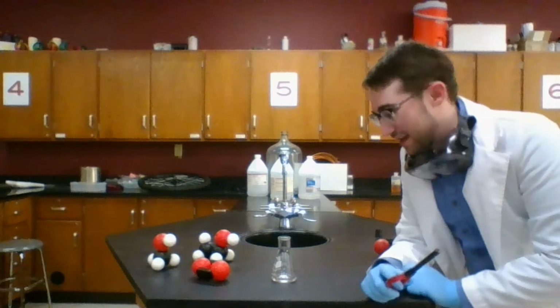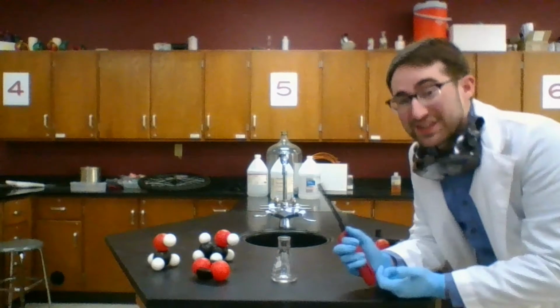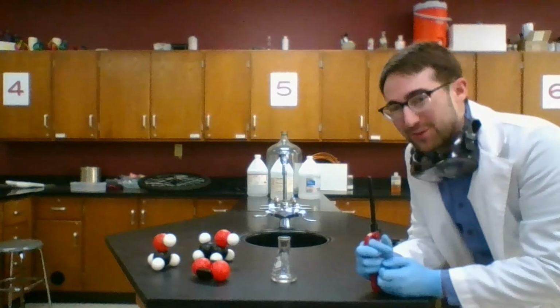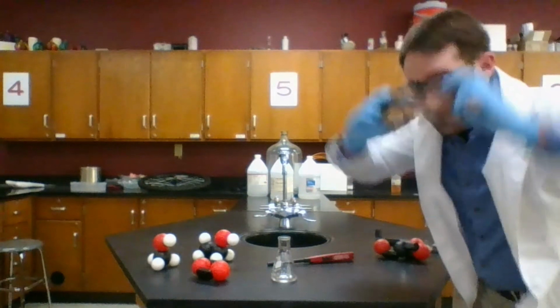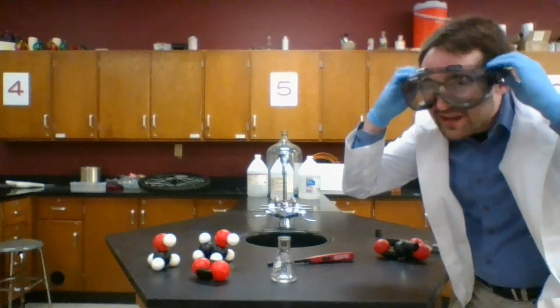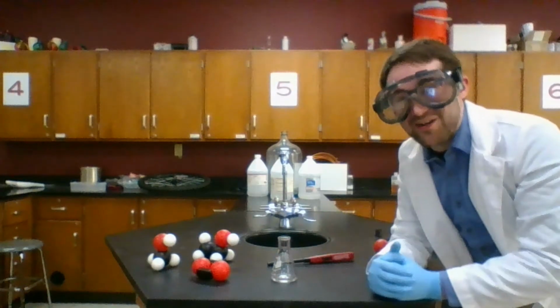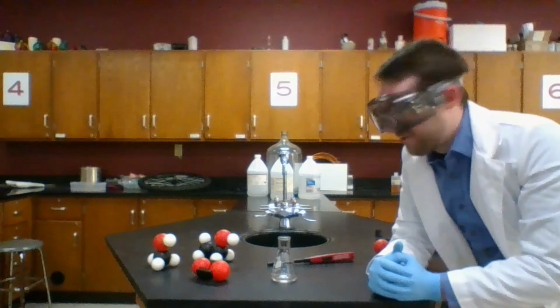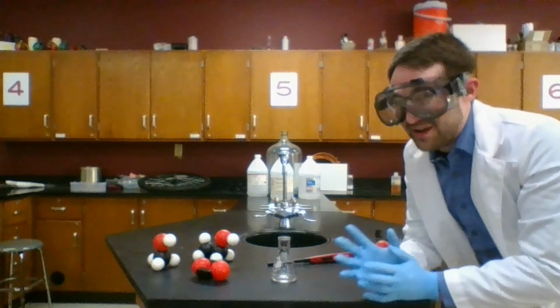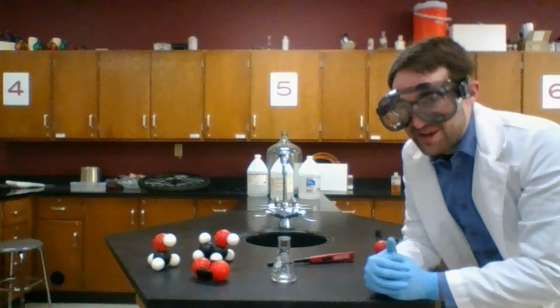All right. Now, this demonstration is done this way, in a flask, and a small scale to keep things safe. But if we want the wow factor of this, we can step it up a little bit. So let's do a bigger version of this reaction with another carbon-containing and hydrogen-containing compound, rubbing alcohol, which is C3H8O. Follows the similar kind of setup of methanol and ethanol, but isopropanol, or isopropyl alcohol, or rubbing alcohol, has a little bit more to react with in that vapor.